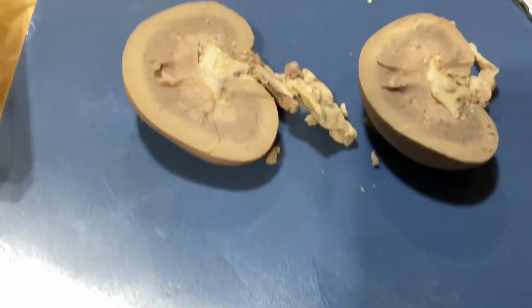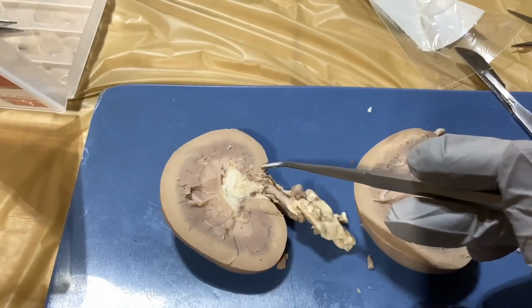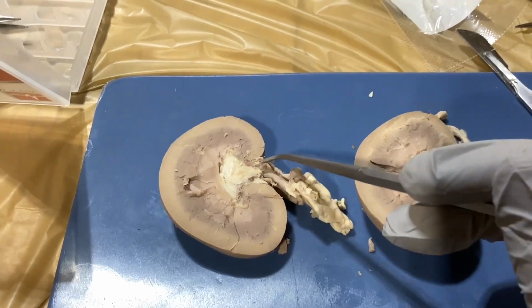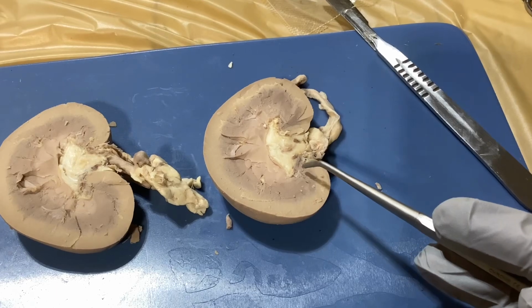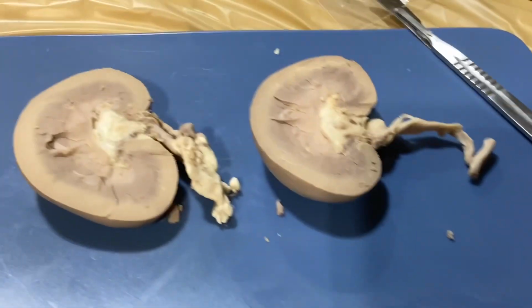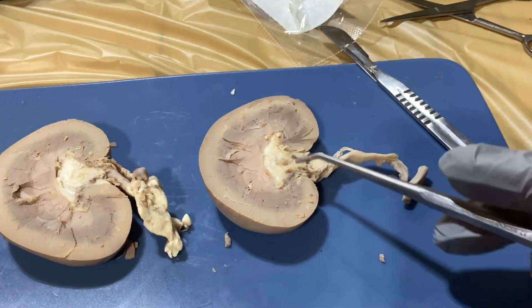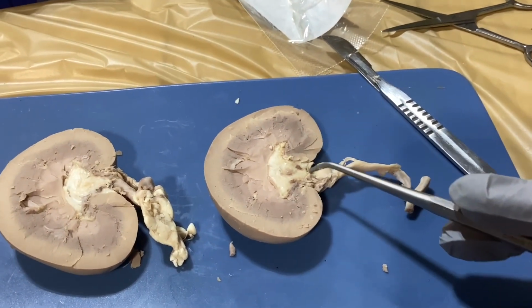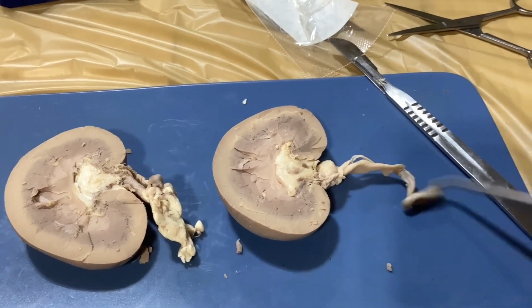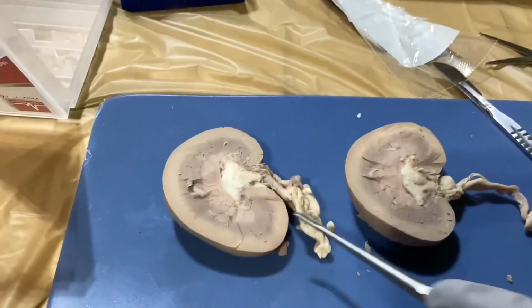And then we have the hilum, which is going to be the little portion in between our artery and our vein. This guy right here is going to be our renal artery, and over here it's a little bit easier to see, but where you have our vein, that's going to branch out also. And then also we have the ureter, which is going to come from the calyx, and it's going to be connected to the hilum, the artery, the vein. It's going to be this little guy that branches out right here. And also you can see it over here a little bit.